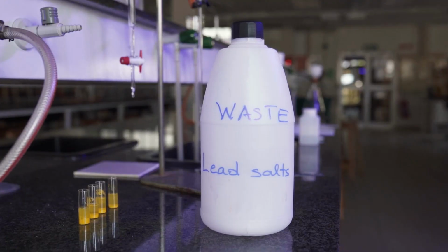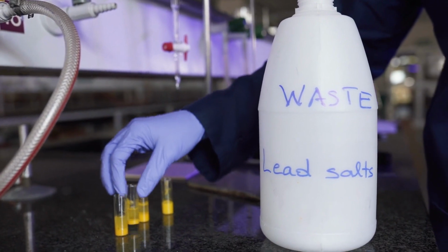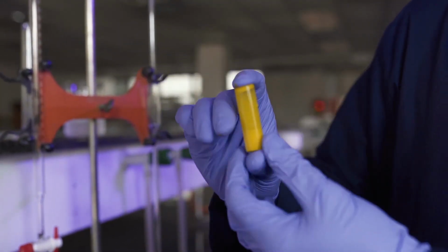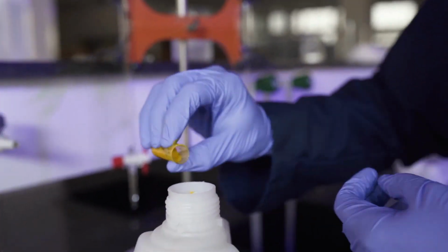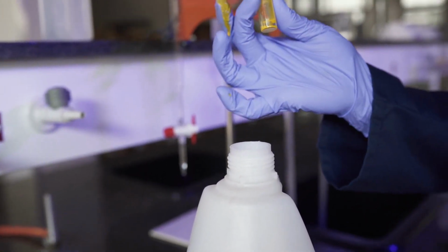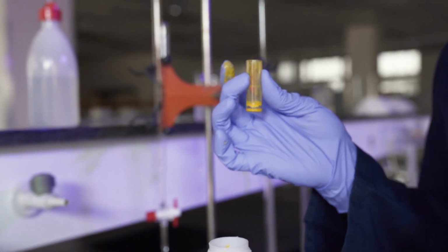Remember that the insoluble lead iodide precipitate that formed is toxic and needs to be disposed of in lead waste. To get the precipitate into solution so that it can be decanted into the waste disposal, we simply shake it so that the precipitate is suspended in solution, after which we decant it into the container. The lead iodide that is left in the vial must be wiped out with a tissue paper, which should be disposed of in solid waste containers.